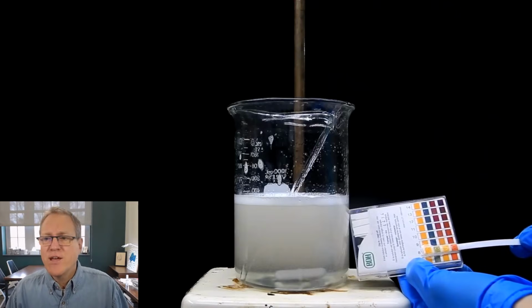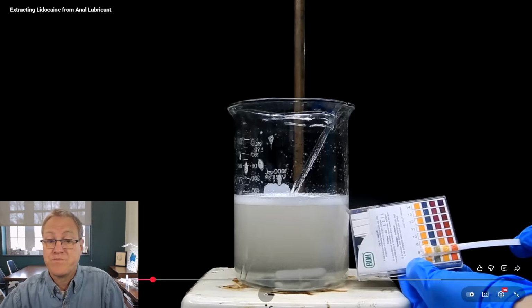That's not surprising. People who use this product, they're presumably going to put it on sensitive areas, and so you don't want things that are wildly different from a pH 7, things that are acidic or caustic. So this material likely contains buffers that make sure, when they make the product, they make sure it has a pH of 7 so it doesn't irritate your skin. And that's exactly what he's finding. He mixed it with distilled water. That won't change the pH. And so he's seeing it gives a pH of 7.